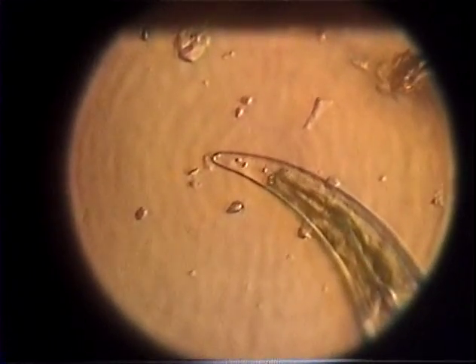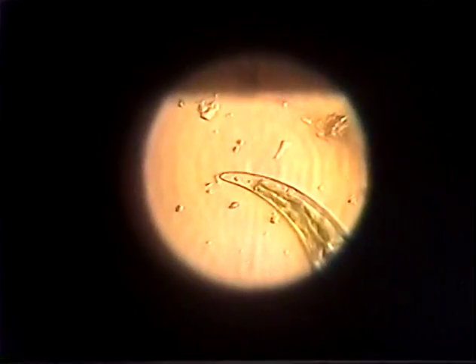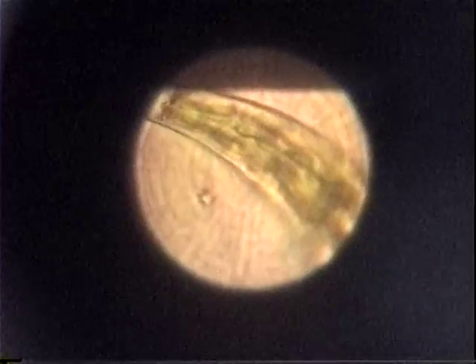All right, I'm going to try to go up to a higher power. You guys ready? Let me zoom this out a little bit. What power is that? Well, you take it up in stages. First, I'm going to focus it. What stage are we on now? The other thing is, it's not quite in the center. Adjust it to these little things.